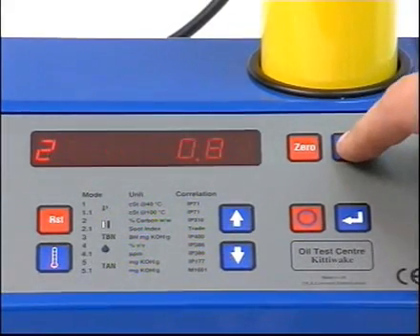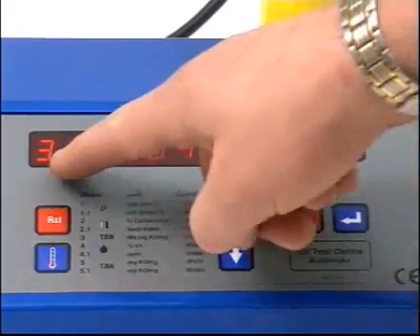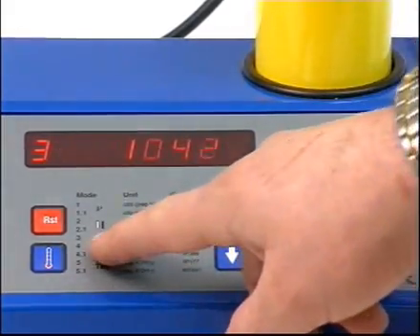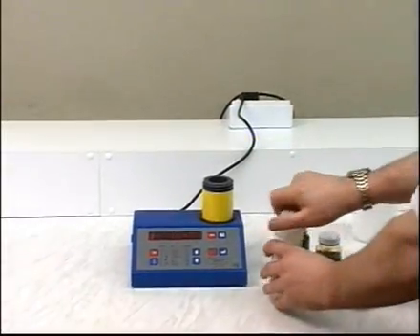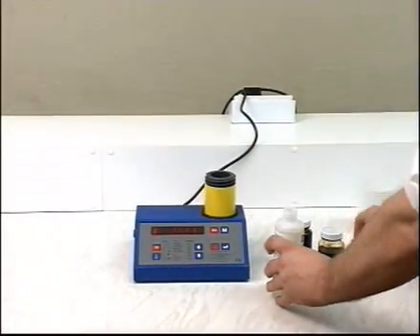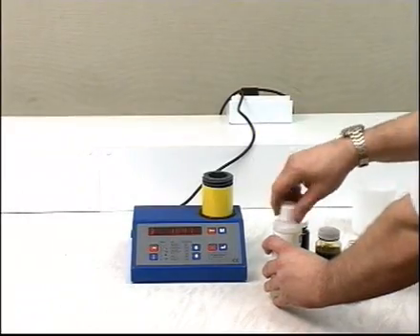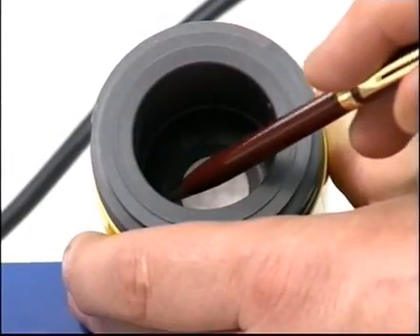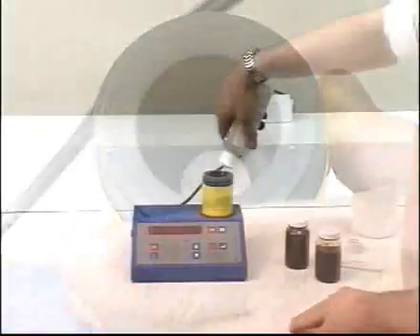To determine the reference value, place the cell onto the console and remove the end cap. Select Mode 3 on the unit. Shake the Reagent C bottle, attach the pourer spout, and fill the TBN cell with it up to the internal lip inside. Be careful not to damage the transducer.